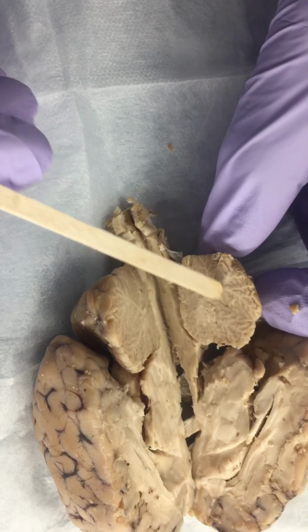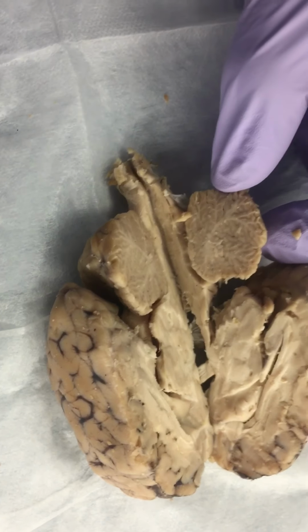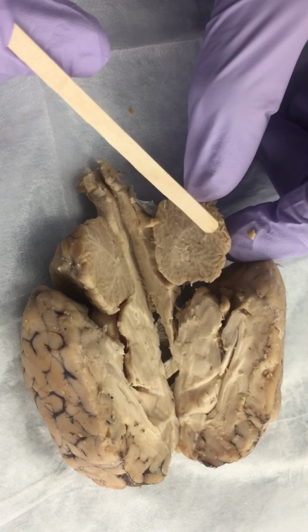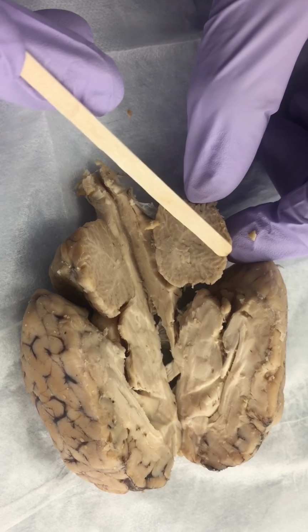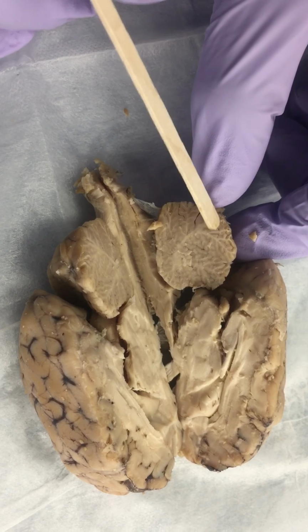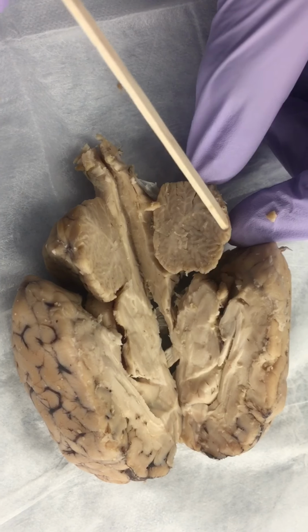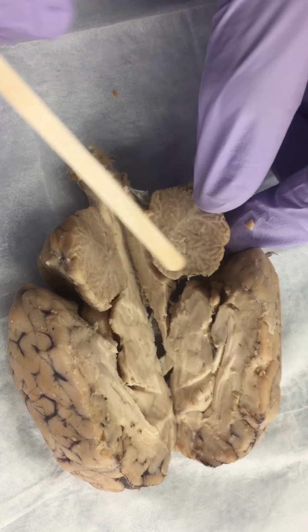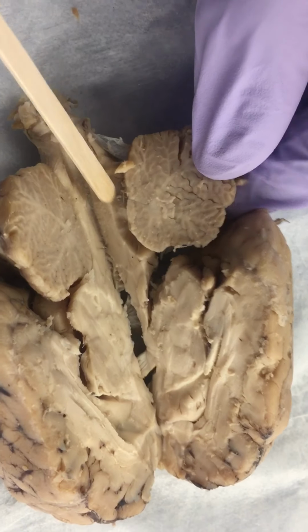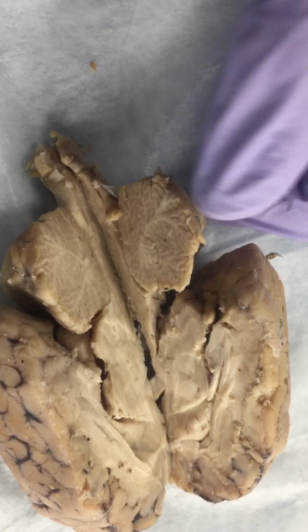You have all the branches, and to go with it, you're going to have your cerebellar peduncles right here. They're going to come in there as they go to those branches. They're so finely detailed, so they give you all the structures you need to see. It looks rough, but it's not really rough. And then connected to them, you're going to have the superior medullary velum right here, which is going to be at the bottom, and which runs right into the fourth ventricle. That gap right there, that's the fourth ventricle. And then that's it.